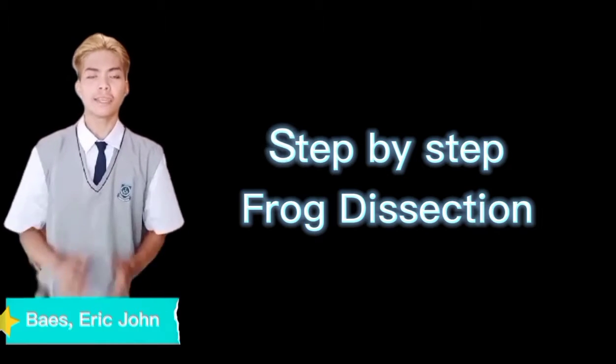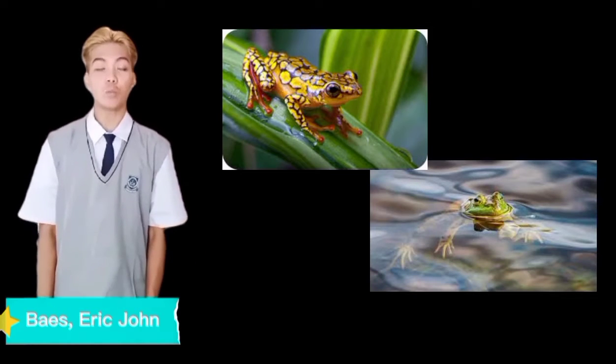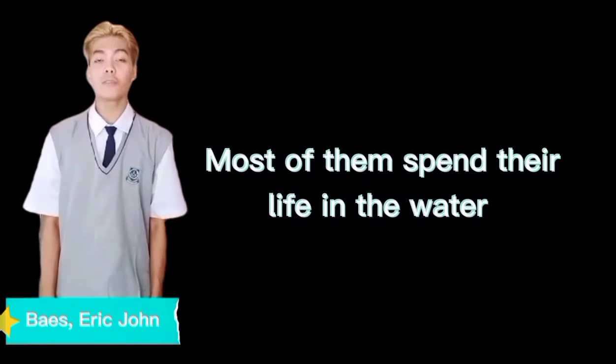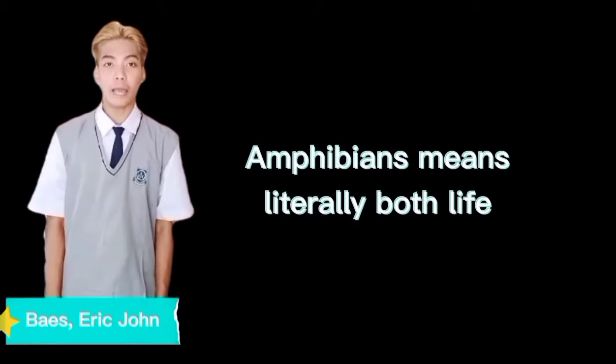We are going to show you a step-by-step frog dissection. Yes, frog dissection. Frogs are the animals that belong to the class Amphibia, commonly known as amphibians. Amphibians both live on land and in water. Sometimes they live in water only before they are fully grown. Also, frogs have moist skin that water can pass in and out of, and most of them spend their life in the water. The name amphibian means literally both life.